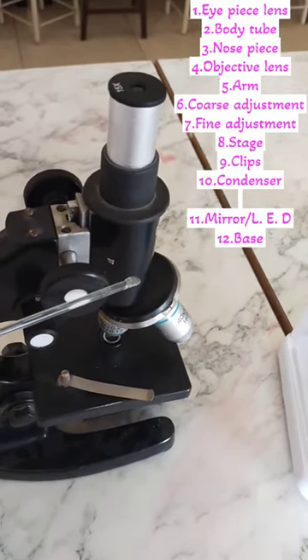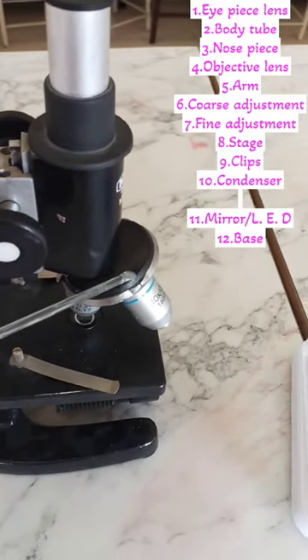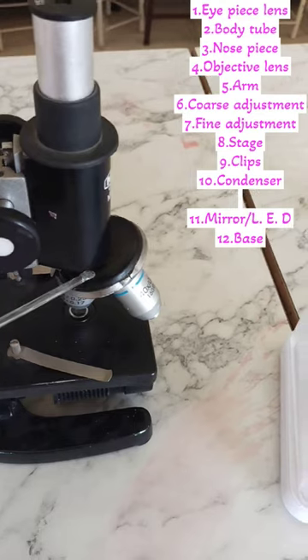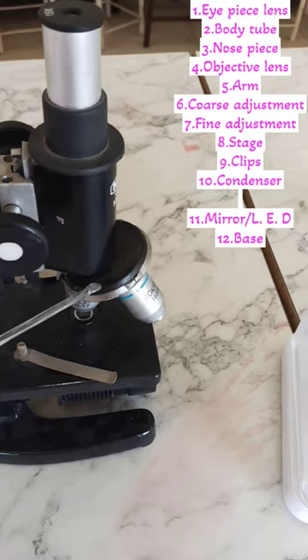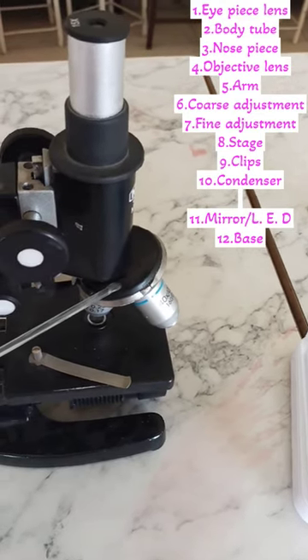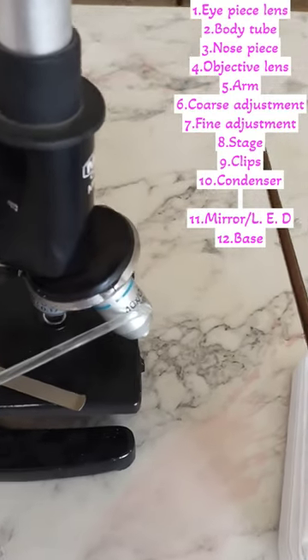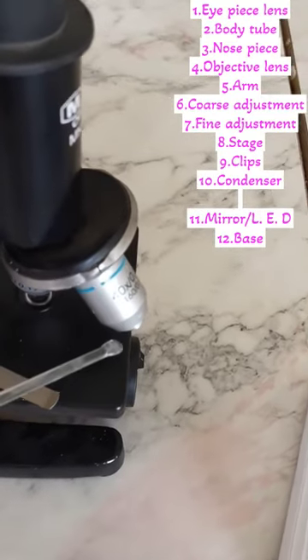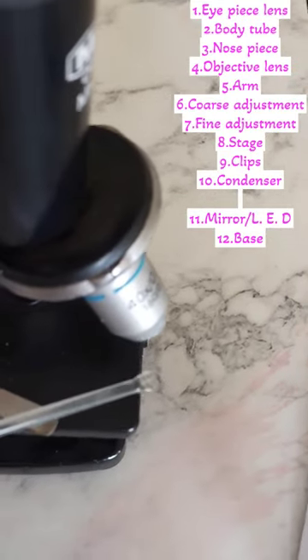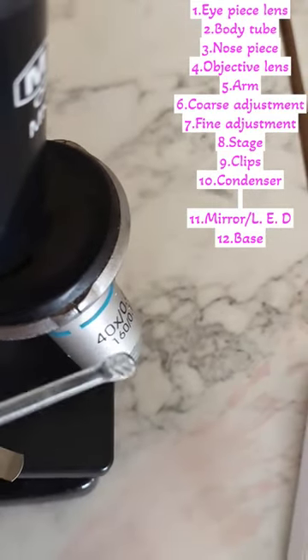Just below the eyepiece lens, there is a tube-like structure known as the body tube. At the posterior end of the body tube, there is a circular structure known as the nosepiece. In the nosepiece, there are two types of objective lens — one is 40x and the second one is 10x.